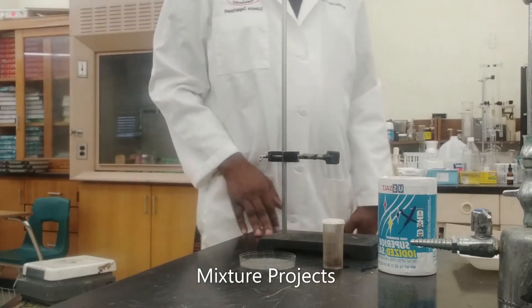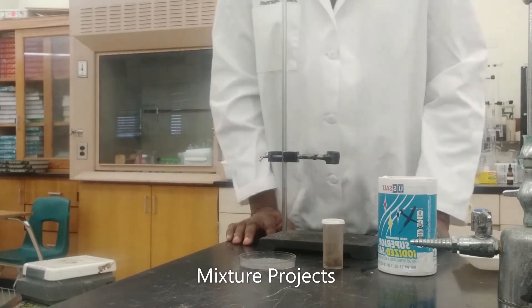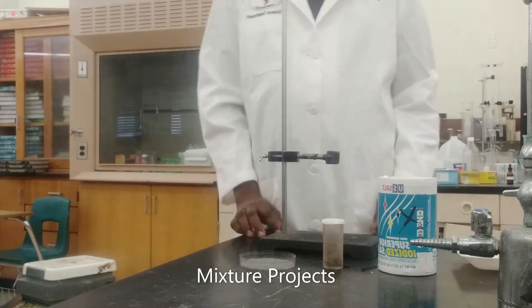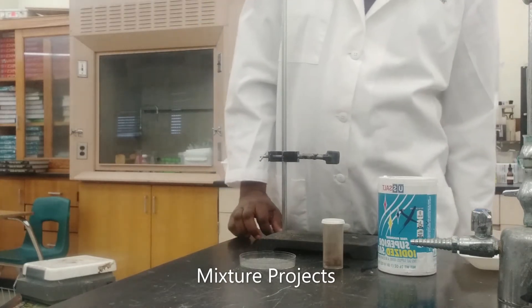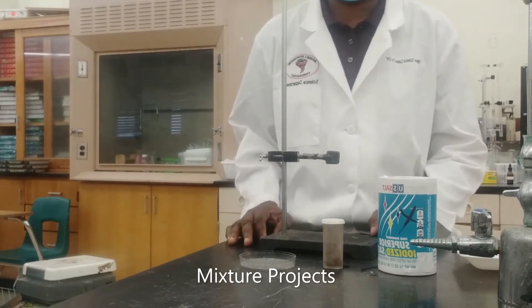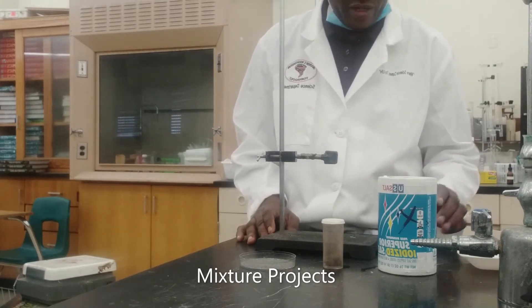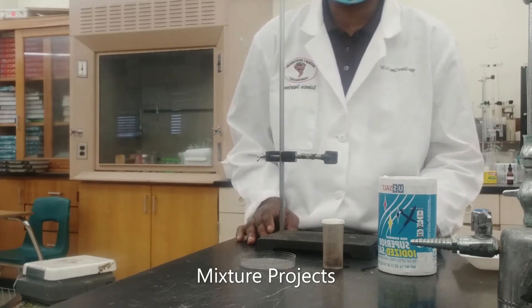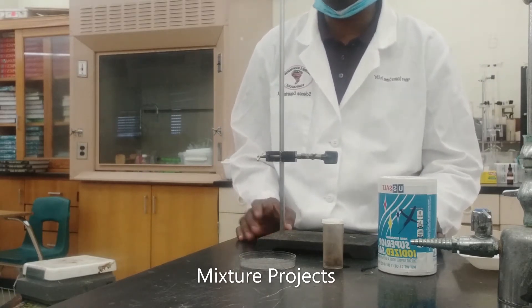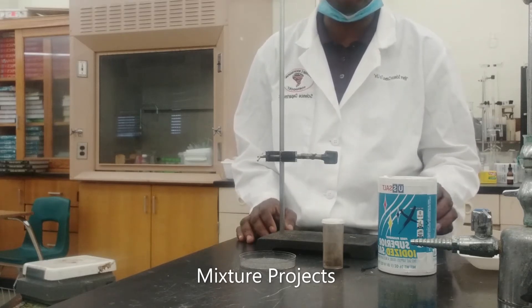Hello and welcome to another Lab Sci lab project. Today we're going to be learning about mixtures and how we can use the physical properties of each component in a mixture to separate the mixture into its individual constituents.